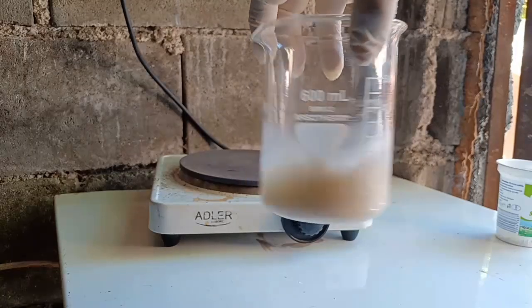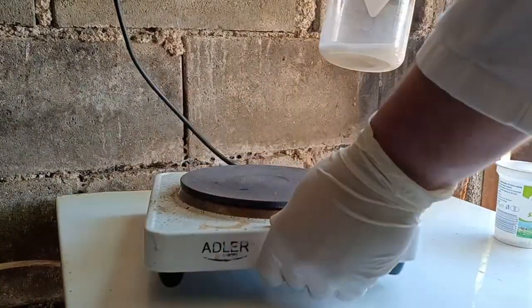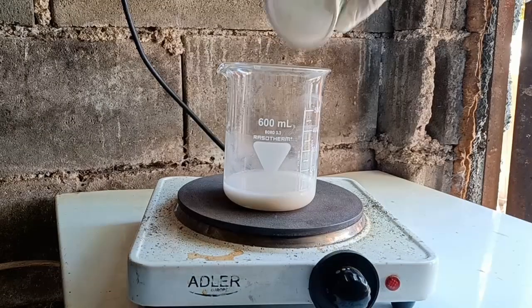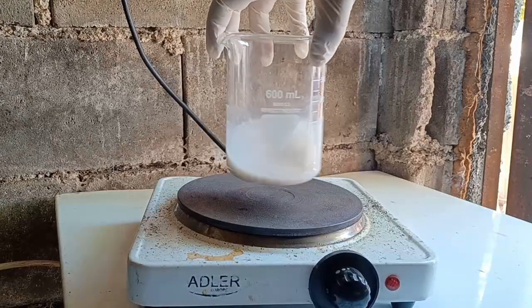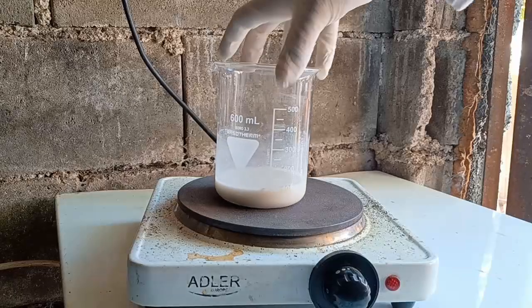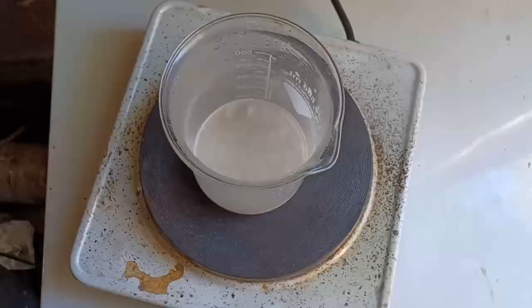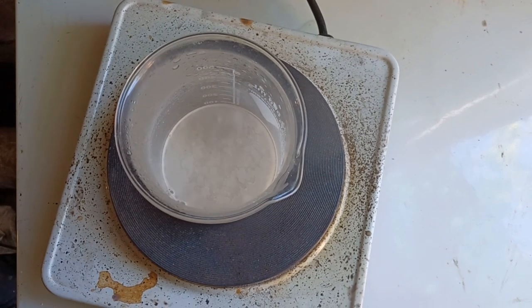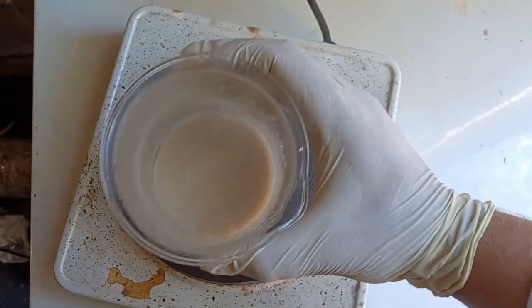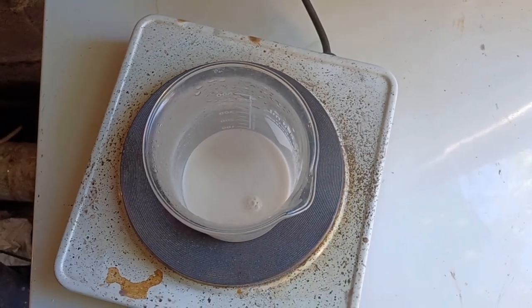To get the reaction going and to drive the ammonia from the solution, I boil the reaction mix for an hour. If you can get calcium nitrate fertilizer, you are more than welcome to skip this step. In fact, I highly recommend you do. High temperature is required to speed up the reaction, and it also removes ammonia from the solution because gases have a lower solubility in warmer water.